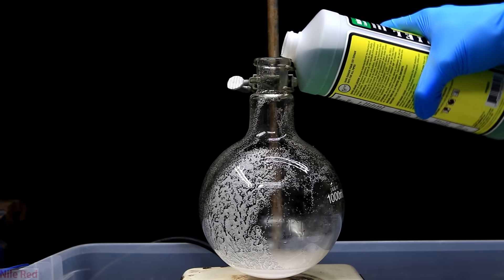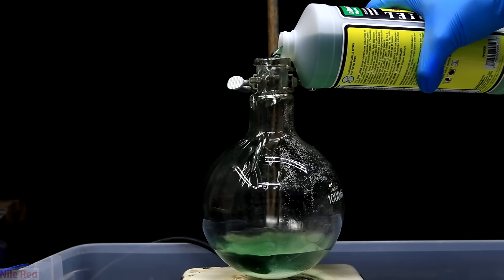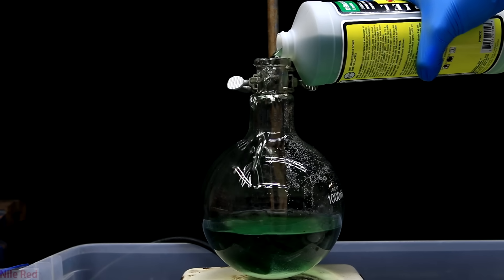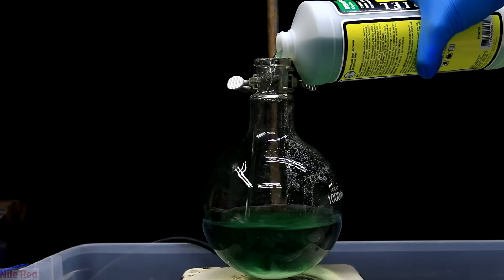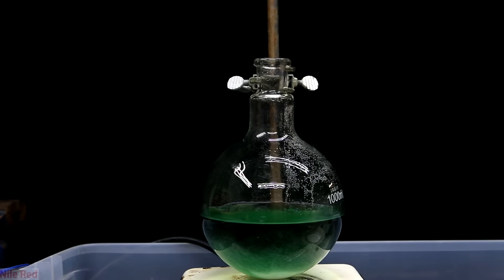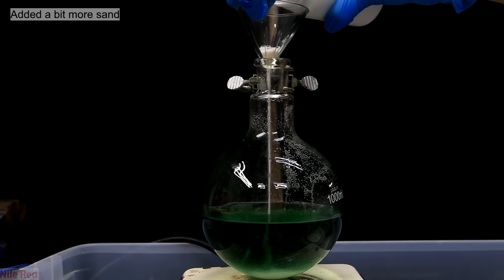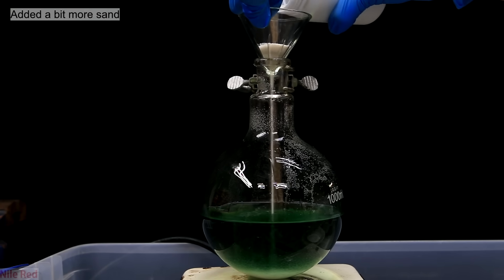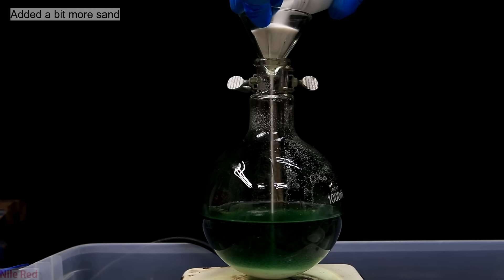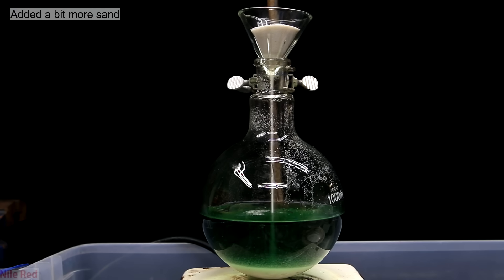The next method is the distillation method, and in my opinion this is superior. I start by filling a 1-liter round-bottom flask about halfway with drain cleaner. In the bottom of the flask I've added broken pieces of glass from the other part, but I've also included a bunch of sand. I didn't like how much bumping was occurring with just the broken glass, and I found that adding sand helped a lot. The sand I had on hand was clean, pre-acid-washed sand, which is why it's nice and white, but plain park or beach sand would probably work just as well.